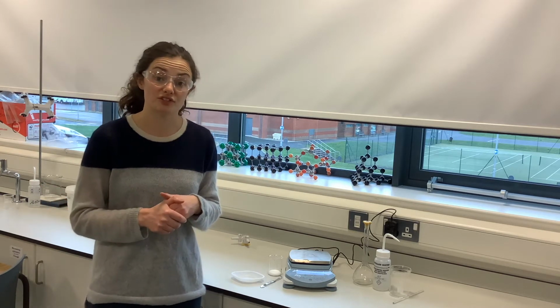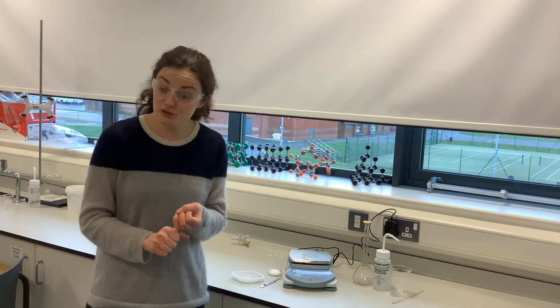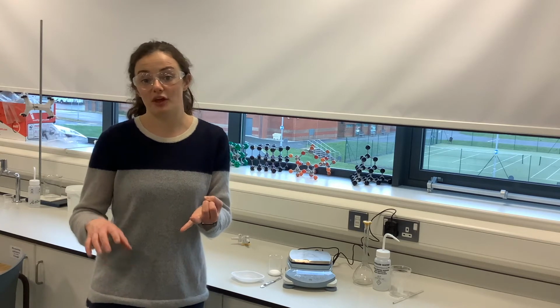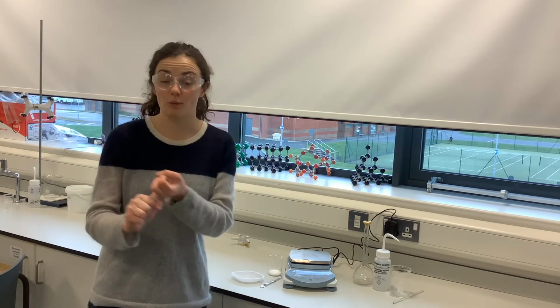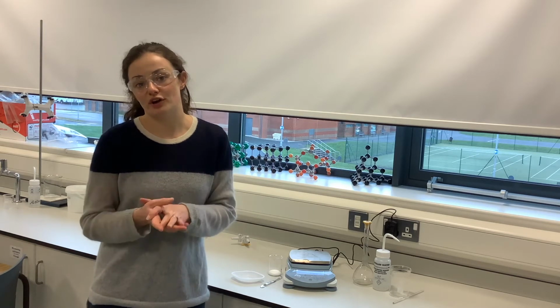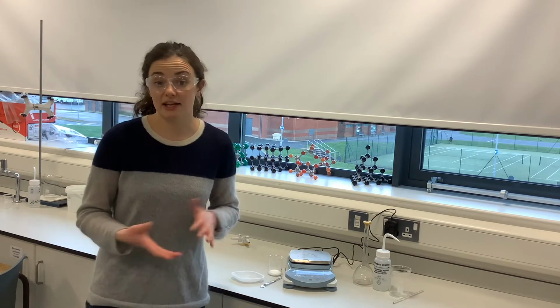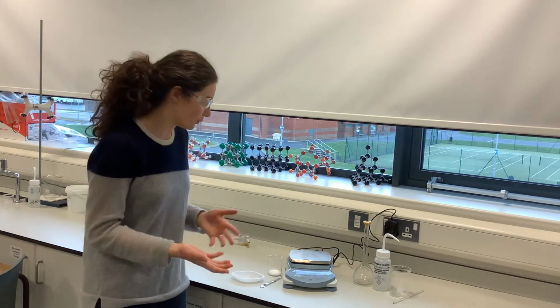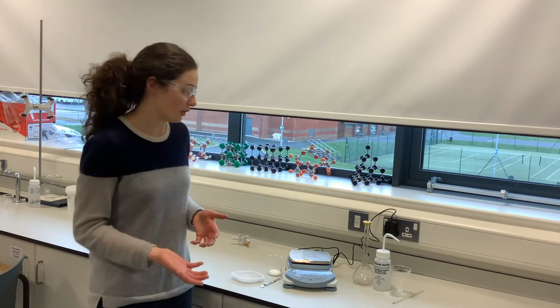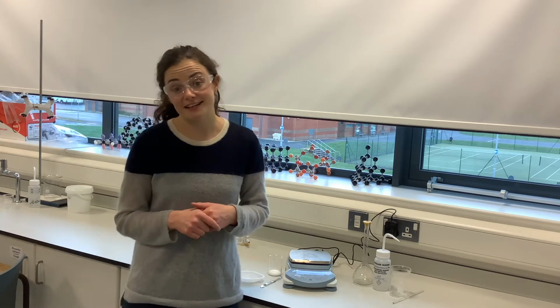And then we can do a titration to work out our number of moles of sodium carbonate in the solution, and then we can work out the mass of the sodium carbonate within the salt. From that we can get the mass of water and work out our ratio in order to determine the degree of hydration, a calculation that you've done before. So we're going to take you through the practical of this experiment now. I'm going to demonstrate it for you, and hopefully we'll get a chance to try this at some stage as a class.